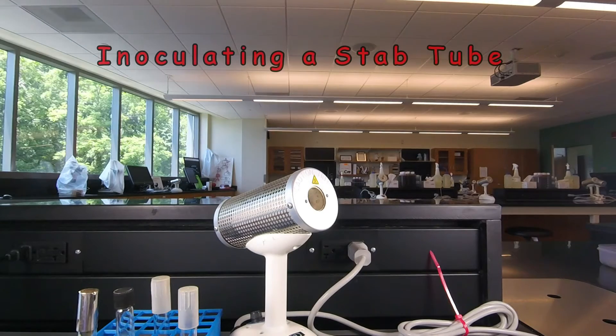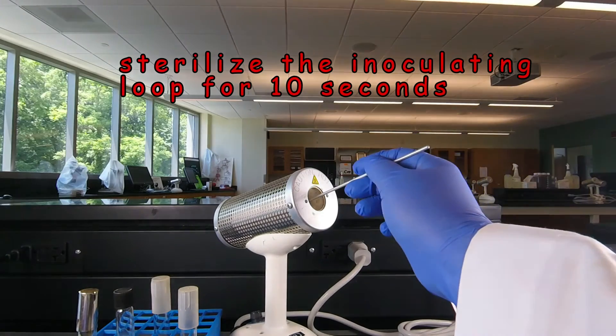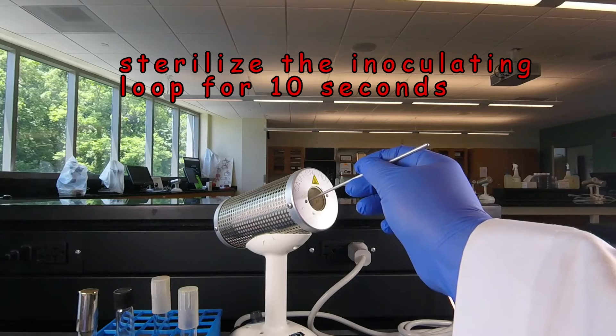We also want to grow our bacteria in a stab tube. Once again we start by sterilizing the loop. Ten seconds in the Bacto incinerator.